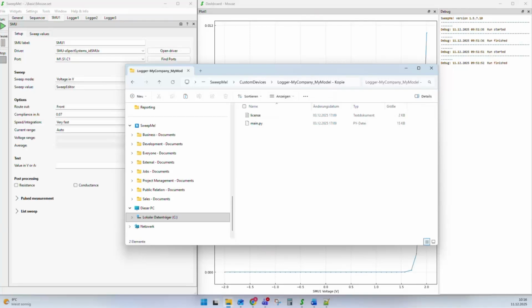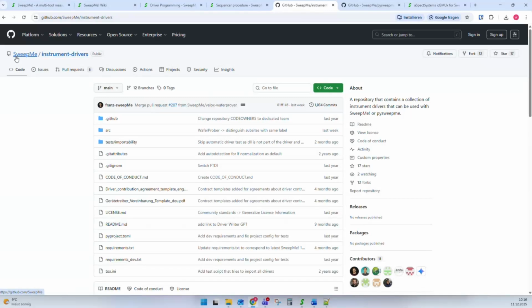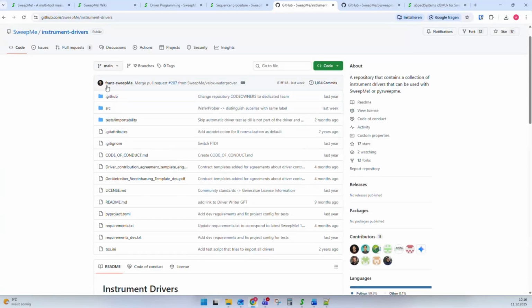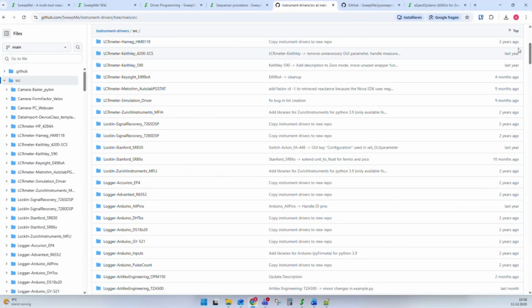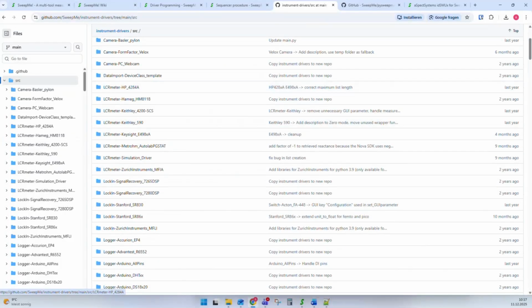A last thing how you can add a driver, or how you can find drivers in the system, is our repository. Let's go to the browser, and I already opened our instrument drivers repository. What you can see is that all the drivers we develop, and for all the drivers that we are allowed to publish, we push them into our GitHub repository called instrument-drivers. And here in the source folder, you can find all these drivers. For the experienced users, it is also possible to clone this repository to your local computer. Then you have all the drivers on your computer.